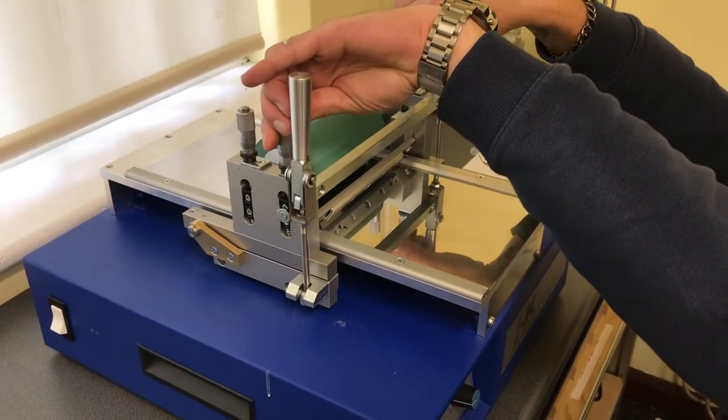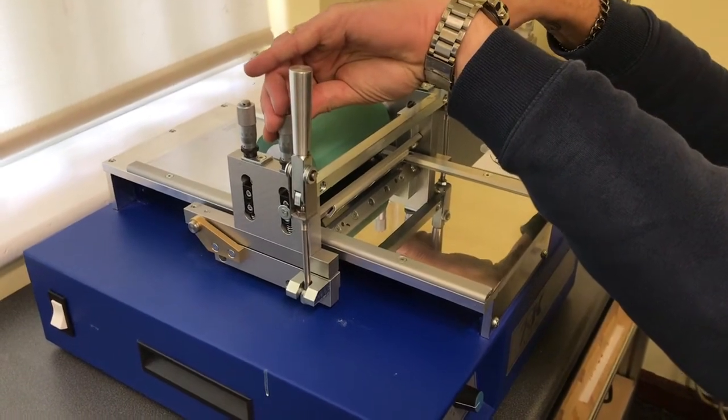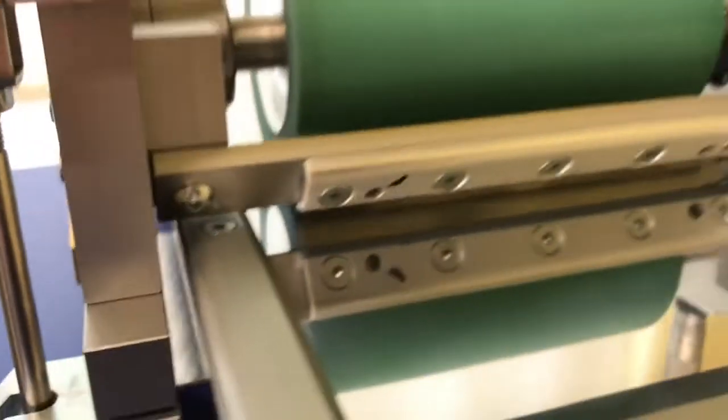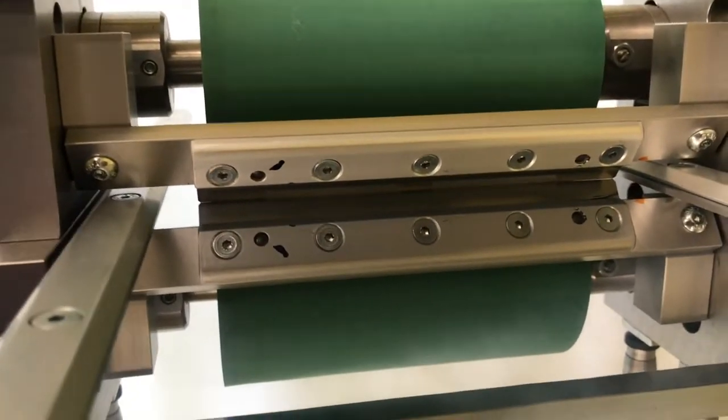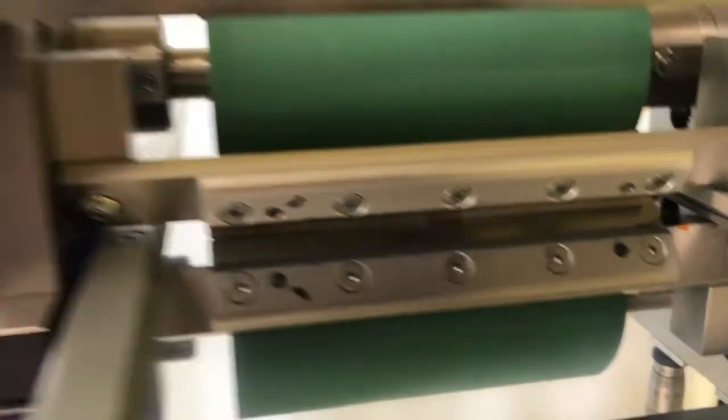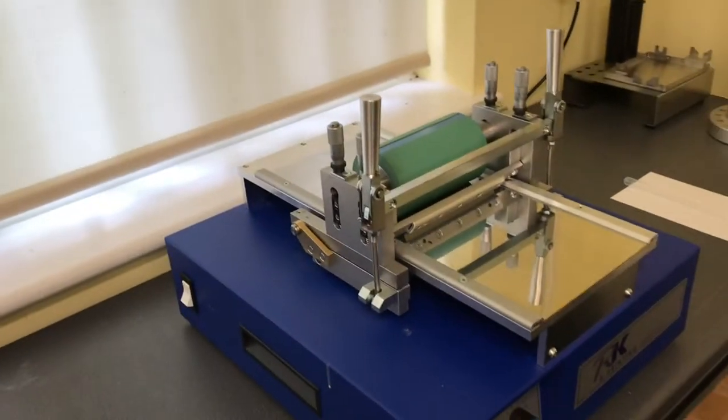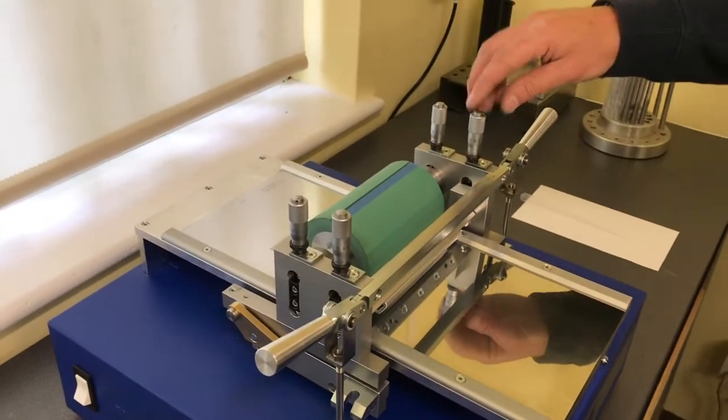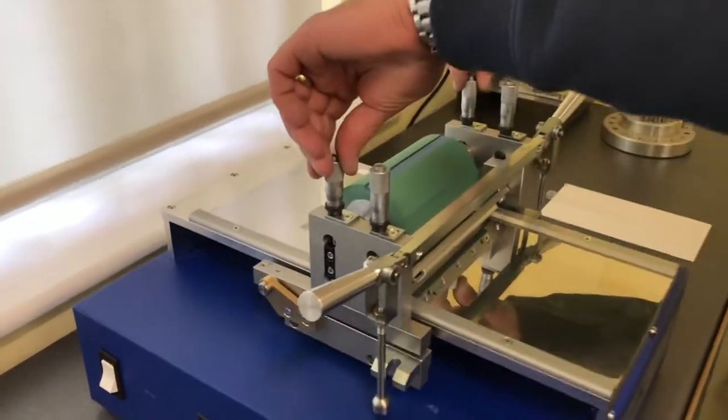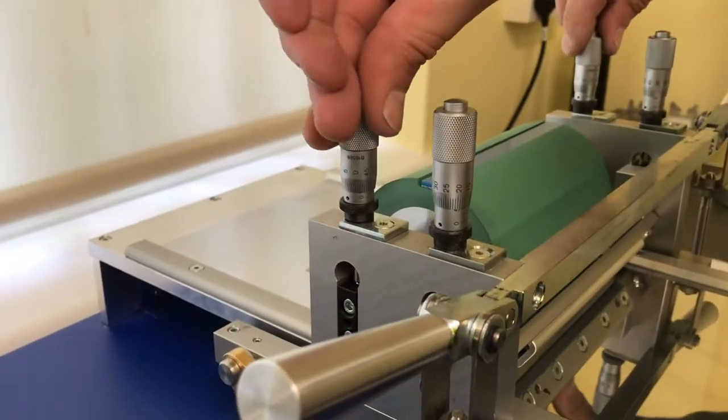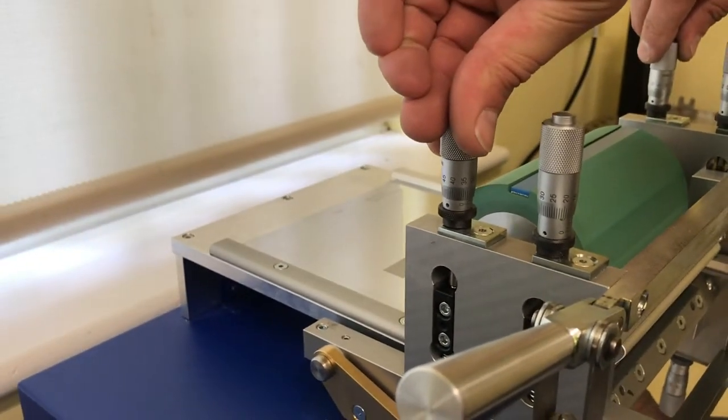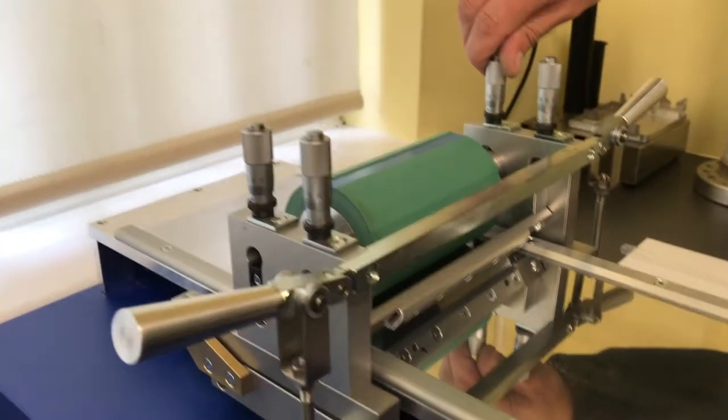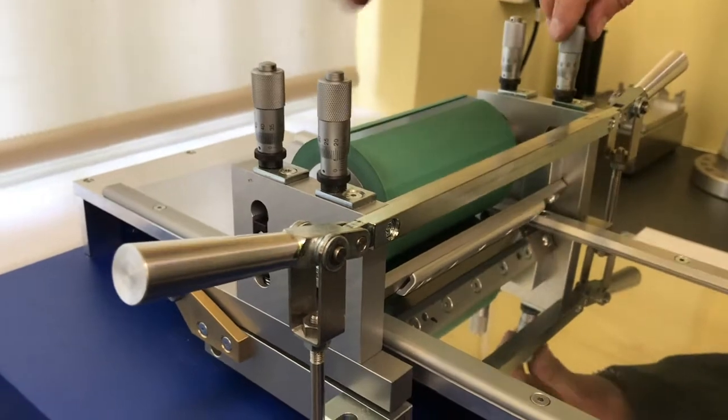Now unclamp your head and add 50 divisions of pressure to the rubber roller, and then add 40 divisions to your Dr. Blade assembly.